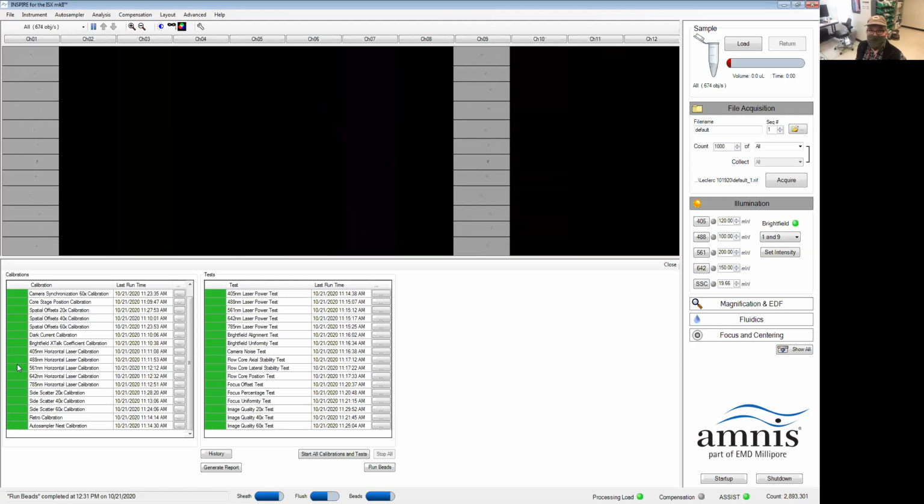Told people forever, it takes about an hour to get the instrument started. So before you get here, call us. We'll get the instrument started for you. So when you get here, this is how you'll find the software.